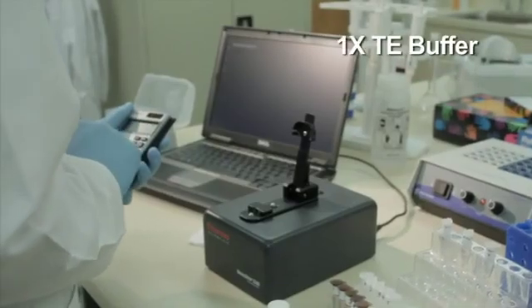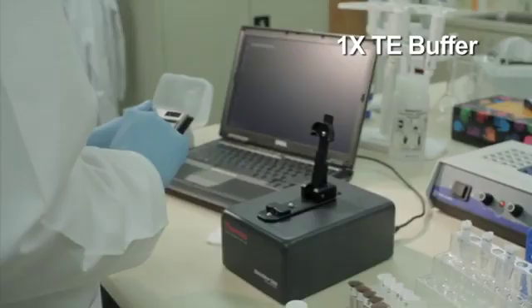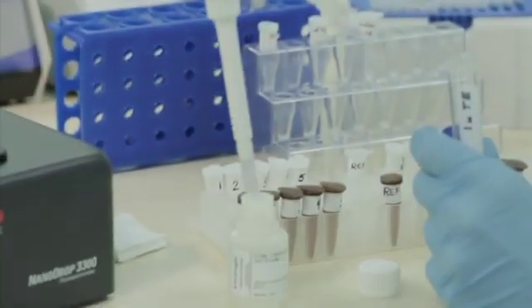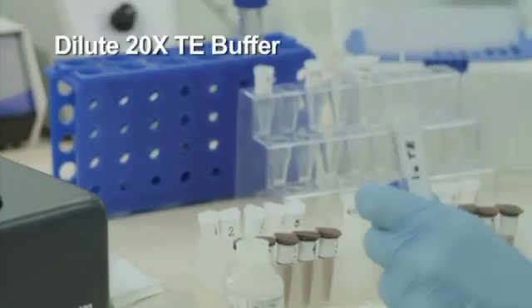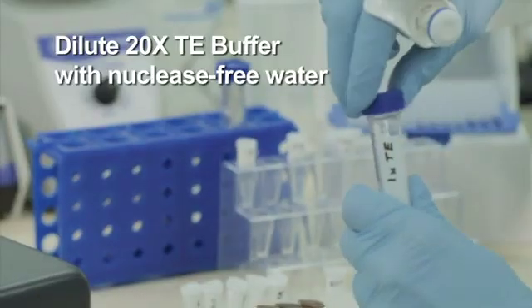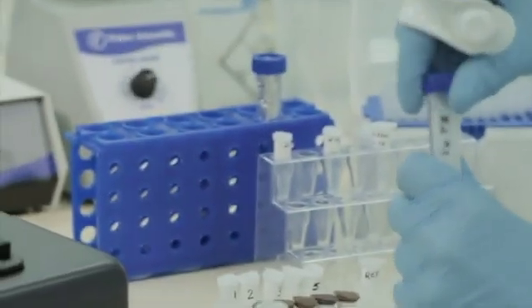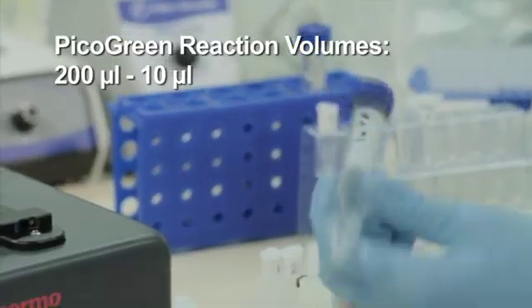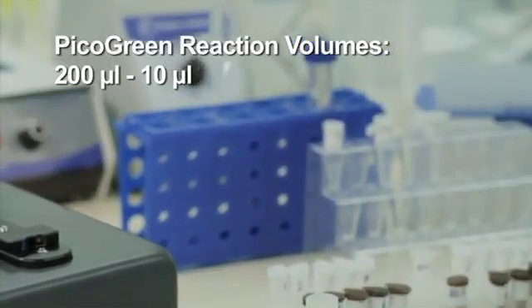Prepare enough 1xTE buffer for all standards and samples to be measured, as well as for the pico-green working solution that will be needed. Prepare 1xTE buffer by diluting the provided 20xTE buffer with nuclease-free water per the manufacturer's protocol. Reaction volumes can range from 200 microliters to as little as 10 microliters. In this example, we will prepare 10 microliter reaction volumes.